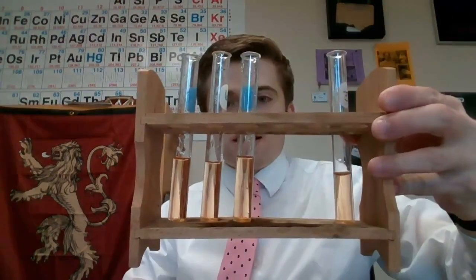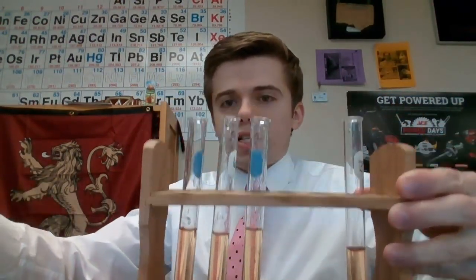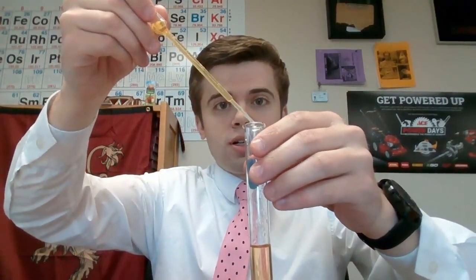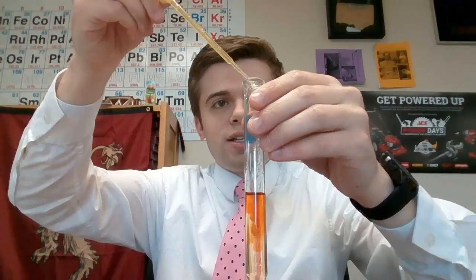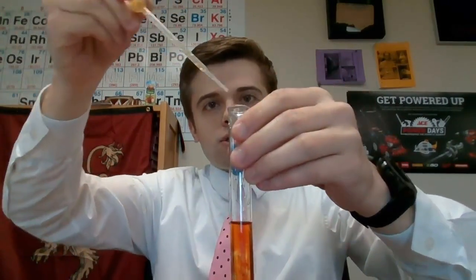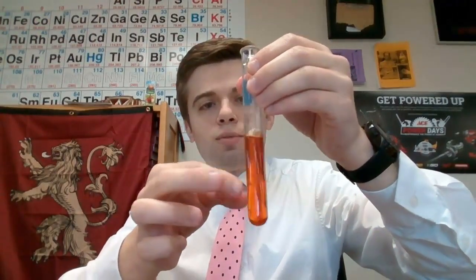Okay, so now I'm going to do our first little experiment here, and I'm going to mix in 20 drops of my iron chloride solution, which is in this pipette right here, into this test tube here. I'm actually going to hold it up so that you can see what's happening. We're going to want to record what is happening in here. We're also going to want to say what direction our equilibrium shifted. I'm going to do 1, 2, 3, up to 17. Oh, we'll do a little bit extra just for good luck. We're going to flick it nice and good, and we want to see what happens.